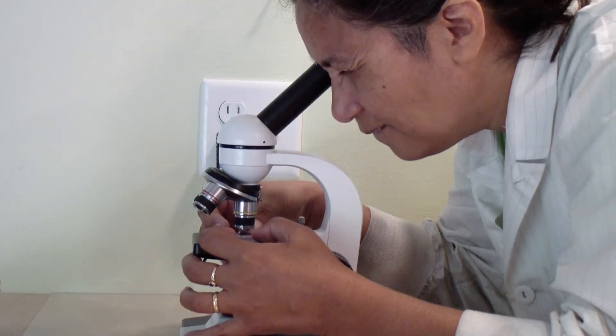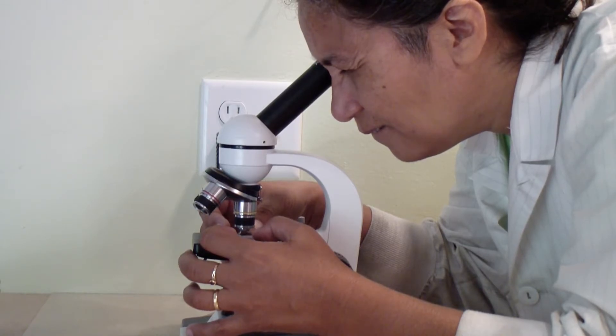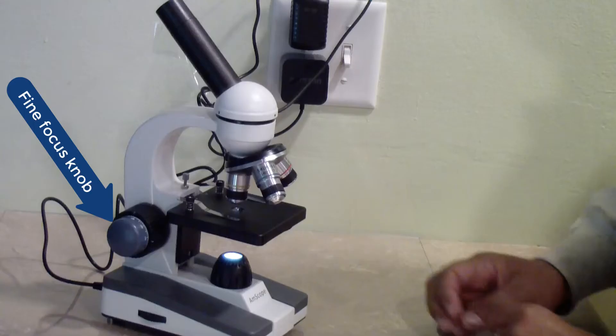You may release the slide clips and move the slide around to scan the slide to look for movement. You may use the fine focus knob to get it just right.